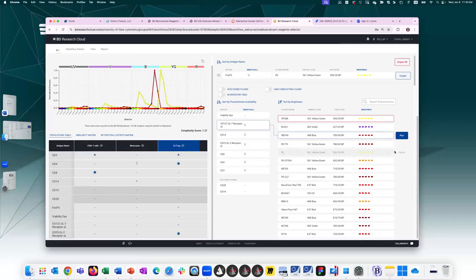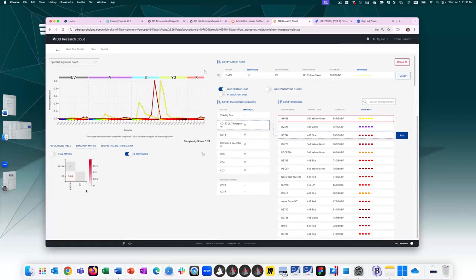If I don't want to see anything that I've already paired, I can use a toggle up here to say hide anything that's already been paired. And what you'll notice is that other fluorochromes may have red box warnings around them as well, such as this one. So if I hover over it, I can read what that warning is. In this case, RY586 has a similarity score with PE that is above 0.9. I can now click over into the similarity matrix and see what that value is by clicking on 586. And in fact, yes, this one has a high similarity.